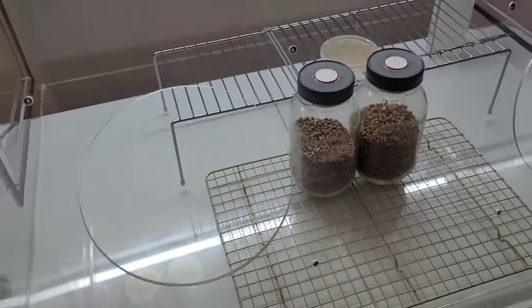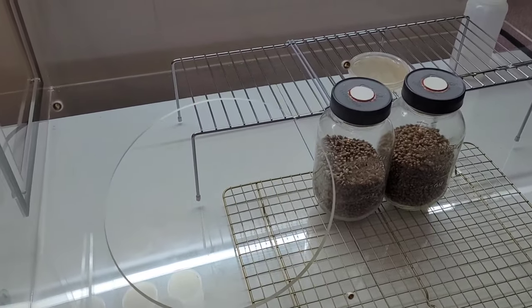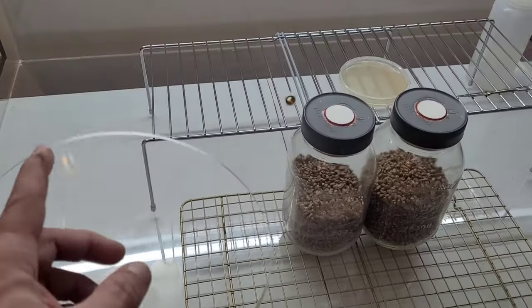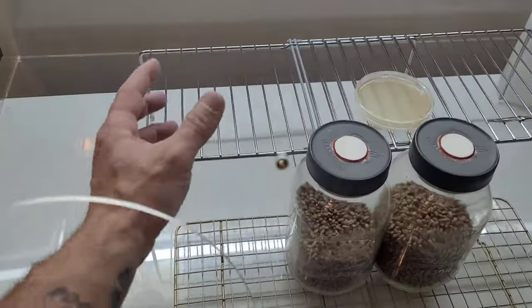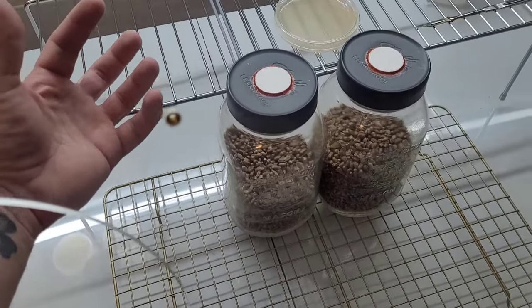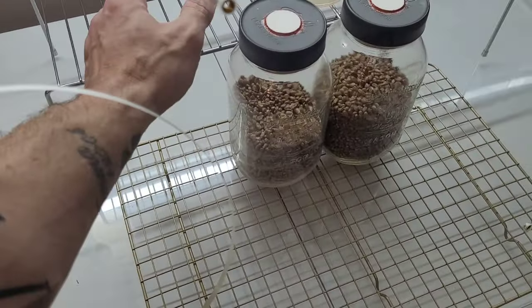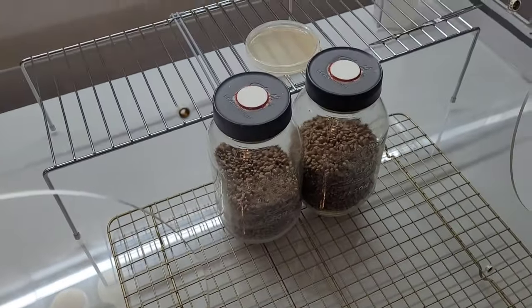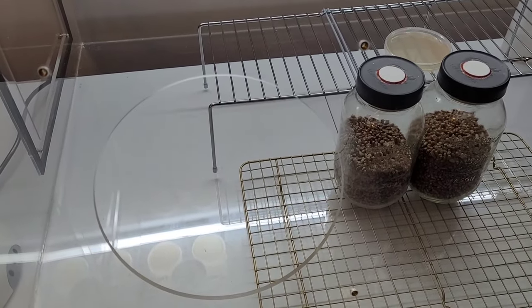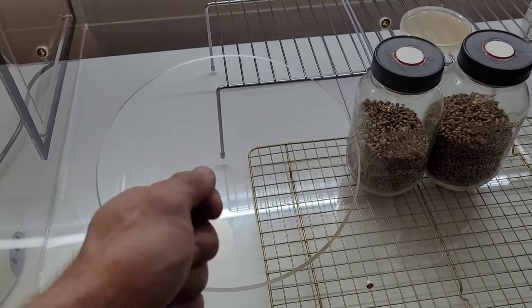Now this is when somebody's going to argue, well why don't I just put some gloves on my hole and turn it into a glove box? Well, the issue remains the same. When you seal up the hole with gloves, you are now disturbing a greater amount of internal atmosphere than you would just by inserting and moving your arm around freely. If this sounds counterintuitive to you, just do a little thought experiment. Imagine that this hole was covered with a neoprene diaphragm with a little handle on it.